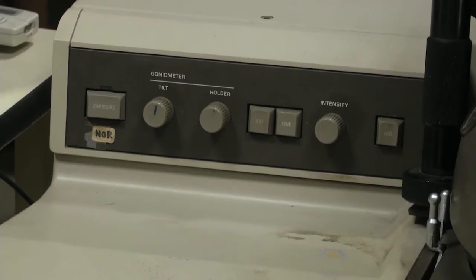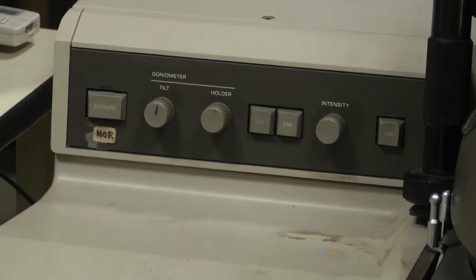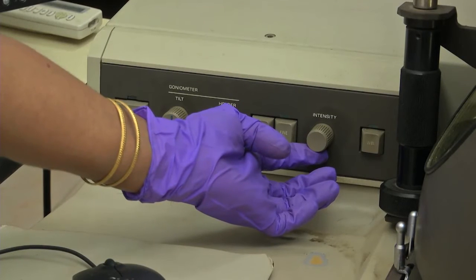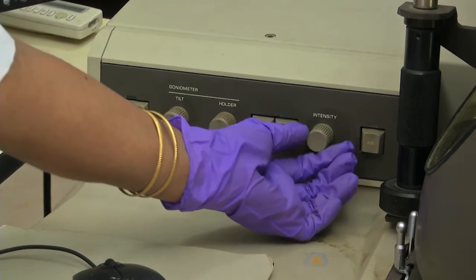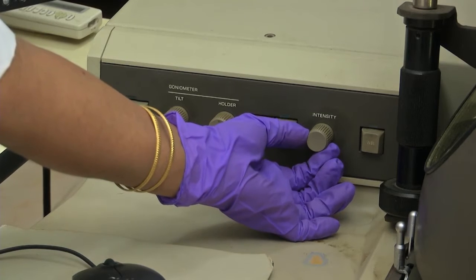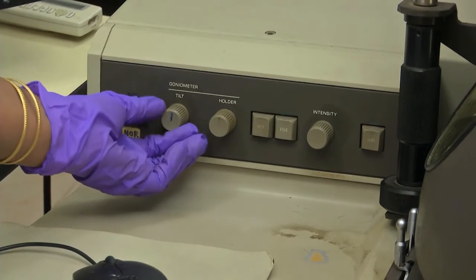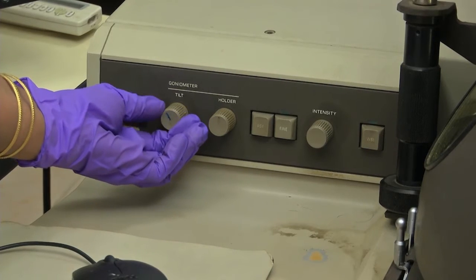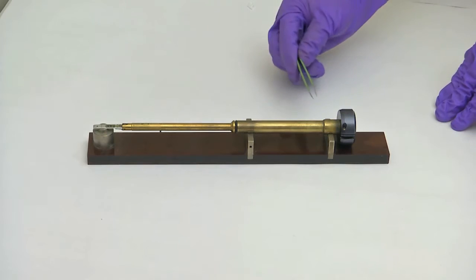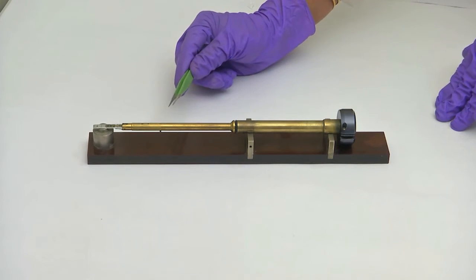Now I am going to show you the controls of this transmission electron microscope. The knobs are here — this knob is the intensity knob; you can converge and diverge the electron beam. These two knobs are for tilting the specimen in both directions: goniometer tilt as well as holder tilt. This is the specimen holder for the transmission electron microscope.